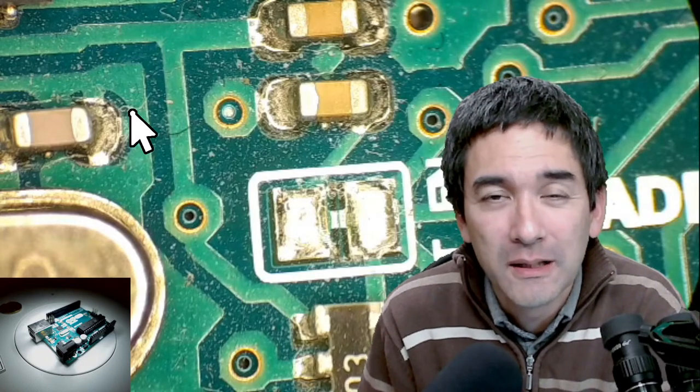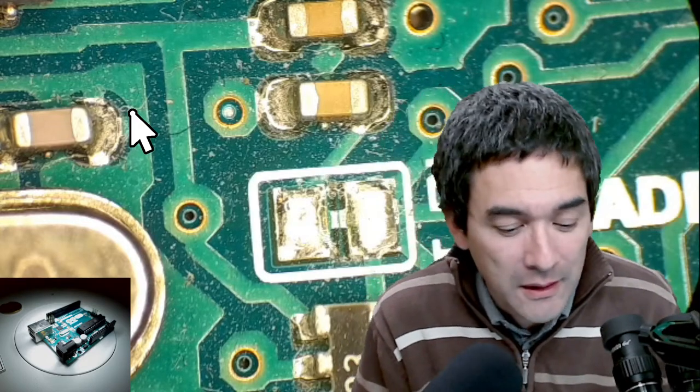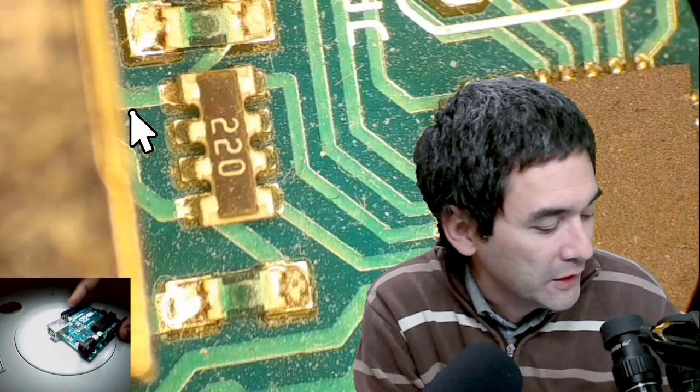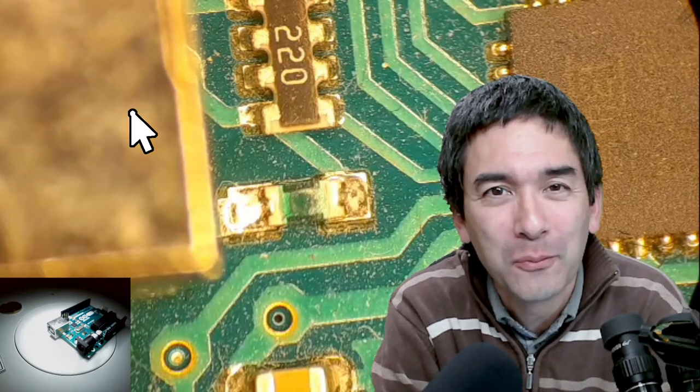I'll talk for about 15 to 20 minutes on some theory and background, explain the system I have here, and then we'll look at a few things under the stereo microscope. You can already see one of them — a small Arduino computer. Stereo microscopes are used for electronics, but I also have a few biological samples. You're welcome to post questions in the chat — we have people joining every week from all over the world.